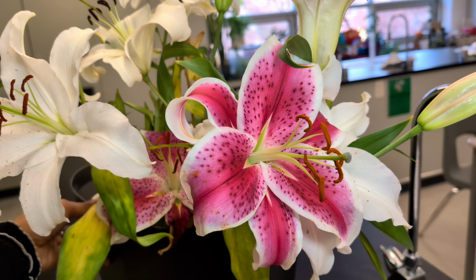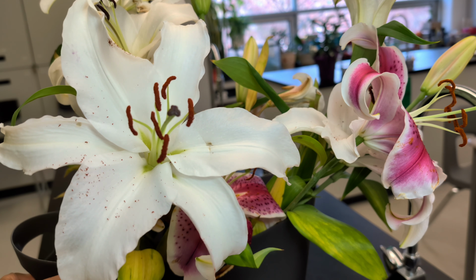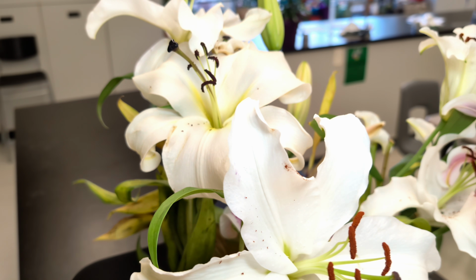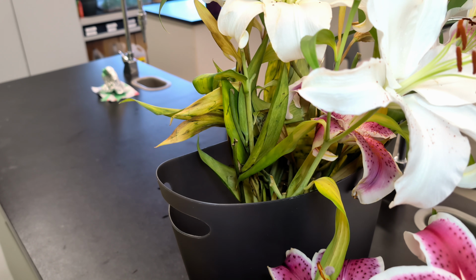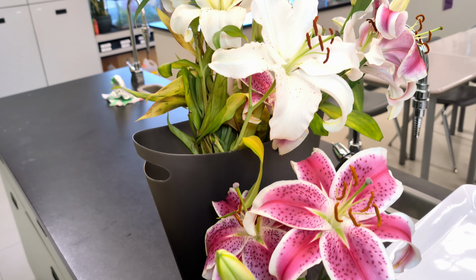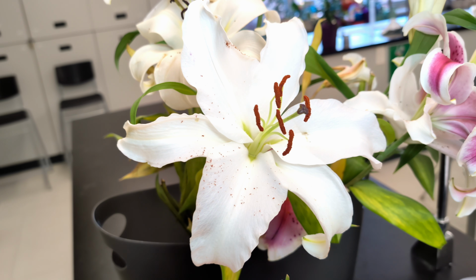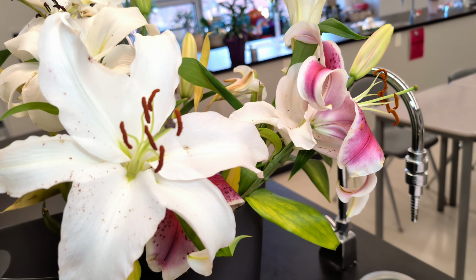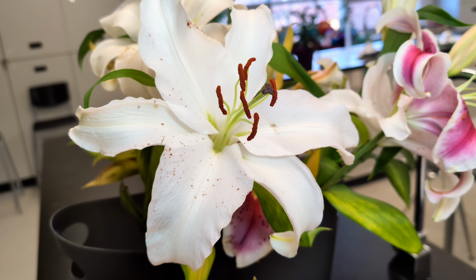Like all flowers, the lily is responsible for plant reproduction. We are using a lily because it's one of the best flowers for dissection. The parts of the lily are large and easy to see and easy to separate compared to most other flowers. Lily flowers clearly show both the male and the female parts, which we're going to look at in a bit. And they are a good example of a complete flower.